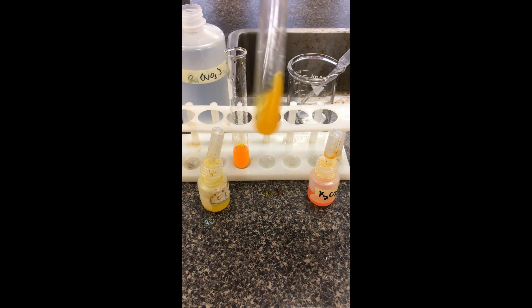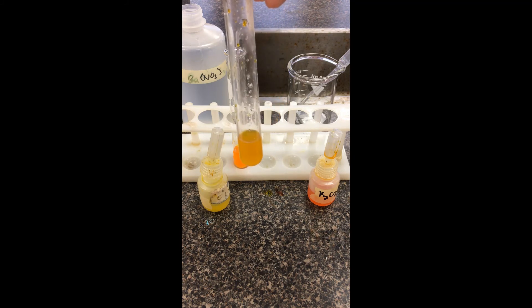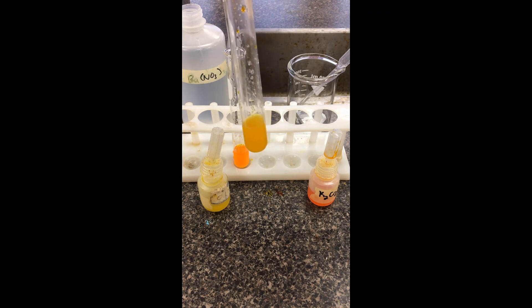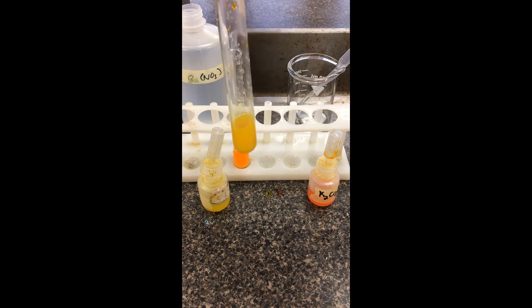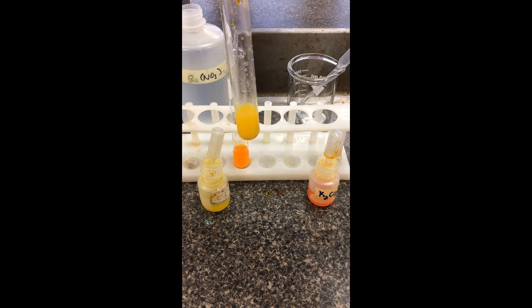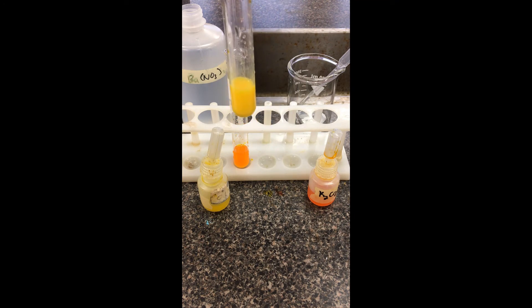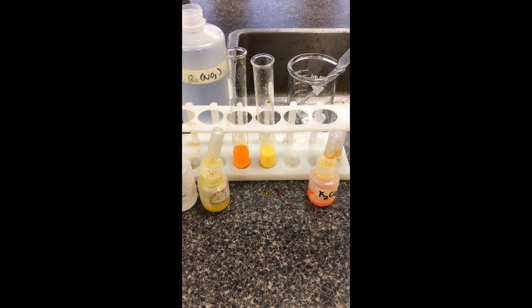We're noting changes in color and changes in clarity as well. Remember, these chemicals are all in the same equilibrium system. We're just doing it in multiple parts, trying to get a feel for what happens if you add one first, then another. We know a lot of these are reversible, and hopefully you can figure out based on the color changes which way these equilibrium systems are shifting.